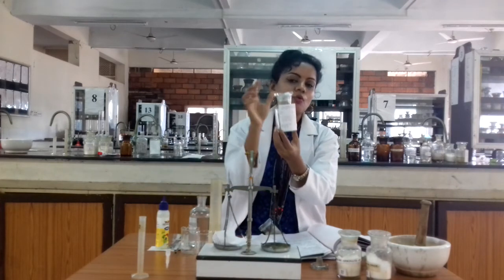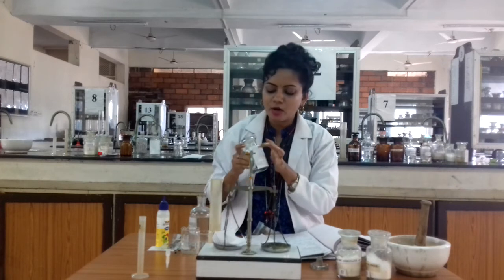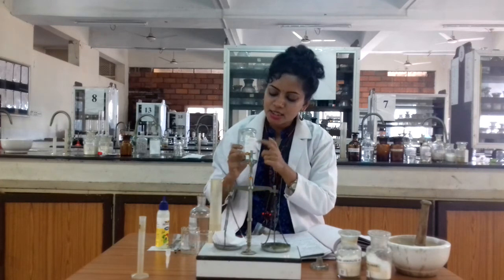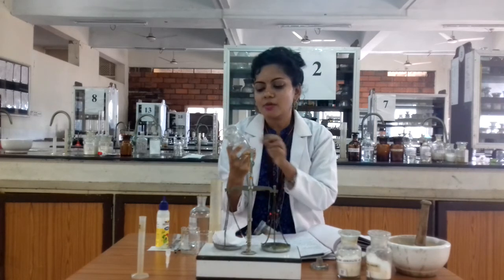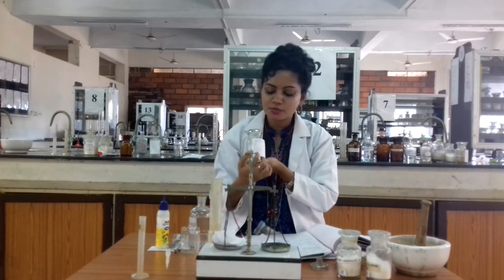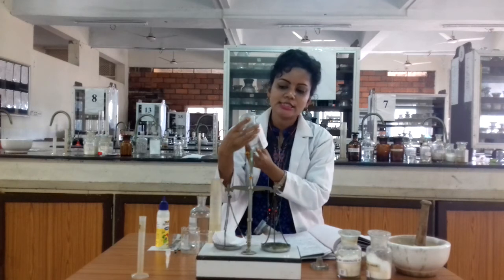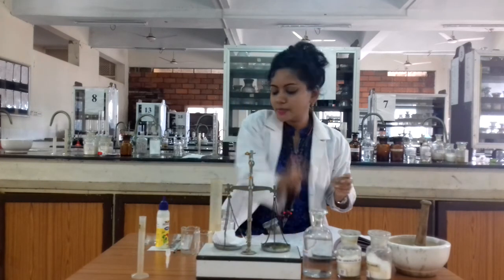This is the dispensing bottle for the sodium chloride mouthwash. For the writing pattern on the label: write 50 mL for the quantity, and the indication is 'not to be swallowed.' Fill in the patient's details — name, age, sex, and place. Direction for use: dilute with equal volume of water before using. Write the place of manufacturing — Pushpagiri Medical College — date of manufacturing, dispensed by, your name, signature, and register number.